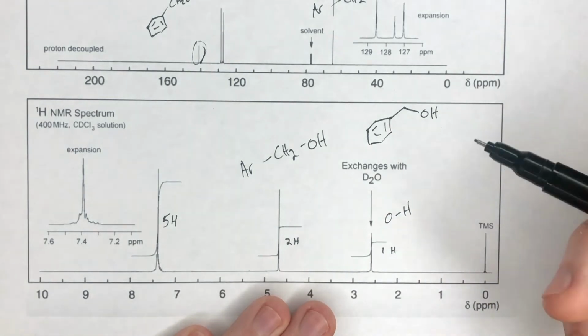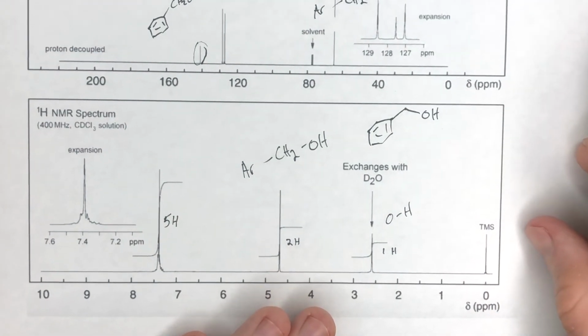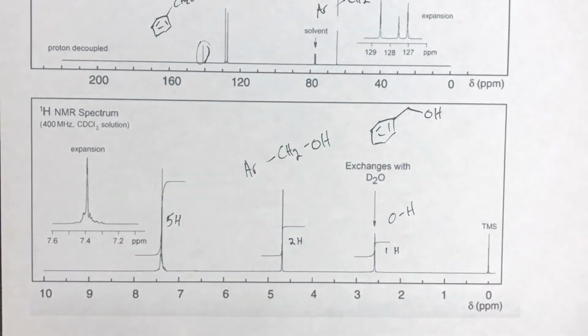So that also doesn't cause splitting because there's no proton there to do the coupling and split. So as such, it makes perfect sense that the CH2 would be a singlet. Does the chemical shift make sense? Well, it's adjacent to an oxygen, which would shift it to about 3.5 to 4, but then it's also adjacent to the benzene, which is also electron withdrawing to a lesser extent than the oxygen, which is why it adds maybe another ppm shift, which puts it around 4.7, close to 5. That matches up pretty well.